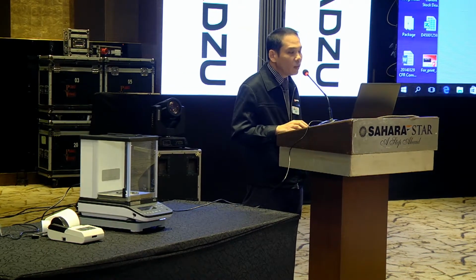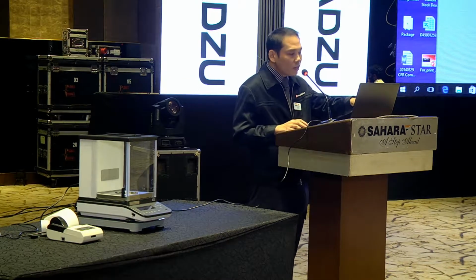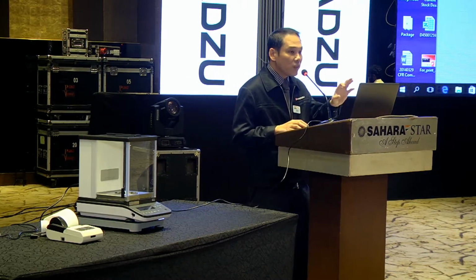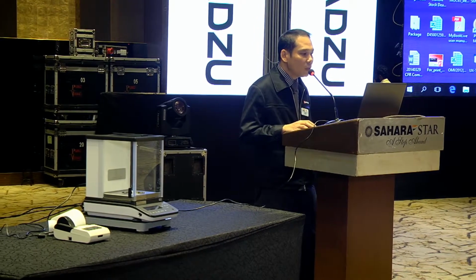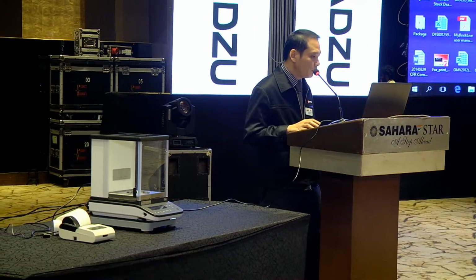So this is done. To know whether your result is registered into the server, you need to log into Lab Solution Manager.